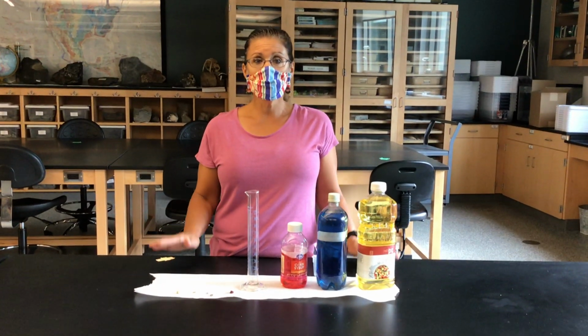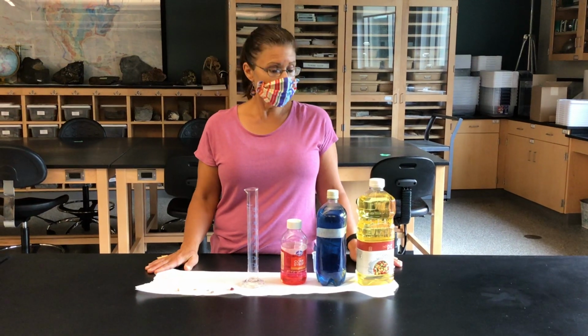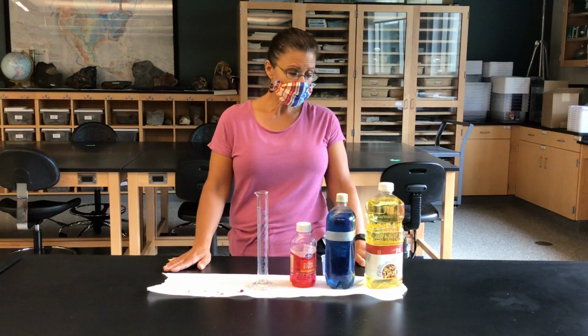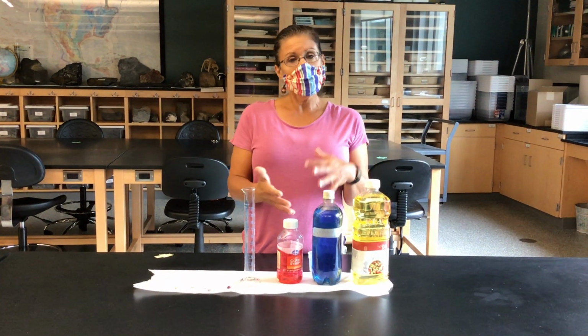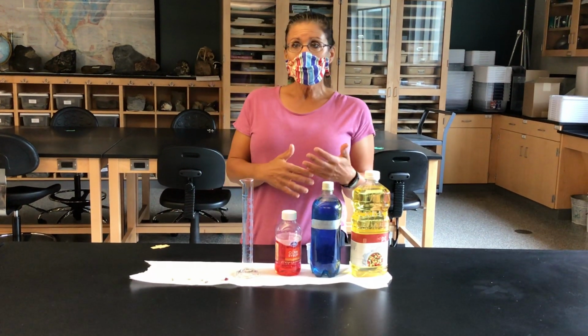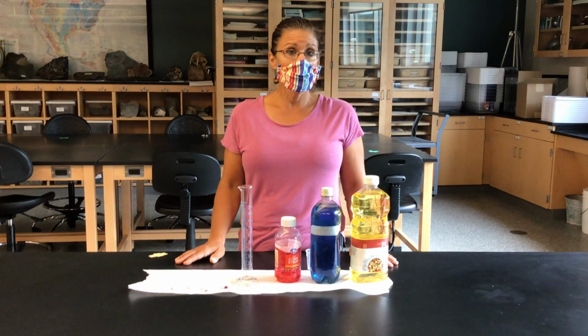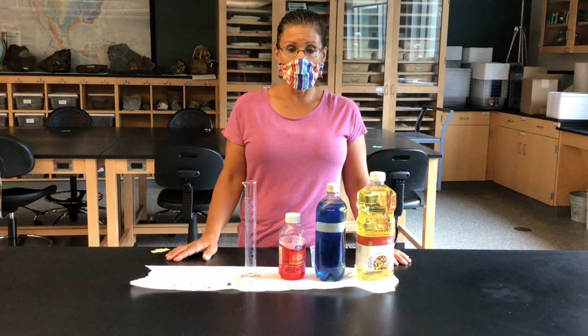Good morning, everyone. Welcome to the Scientific Method Lab. This is the online version of our in-class lab for those of you who weren't able to attend class. So the purpose of today's lab is to do an experiment with some fluids and some solids and develop a hypothesis and then work through the scientific method process to determine if your hypothesis is correct or not.